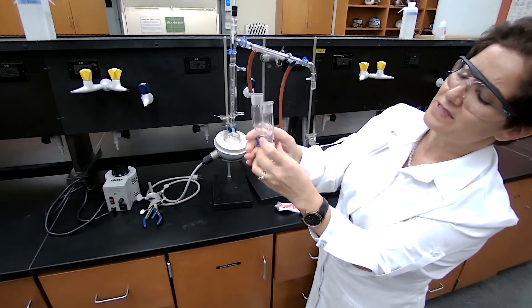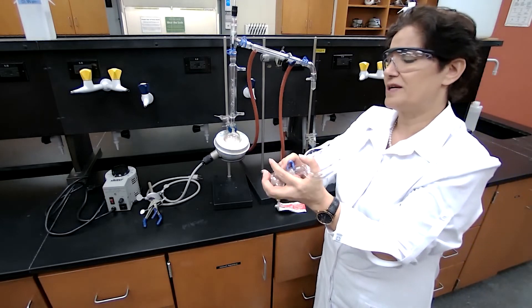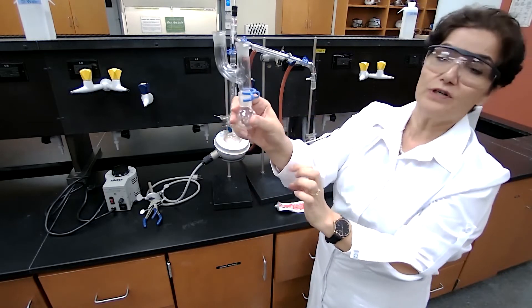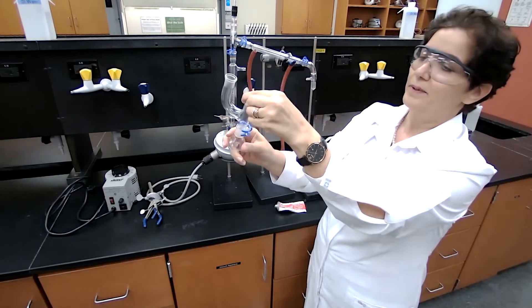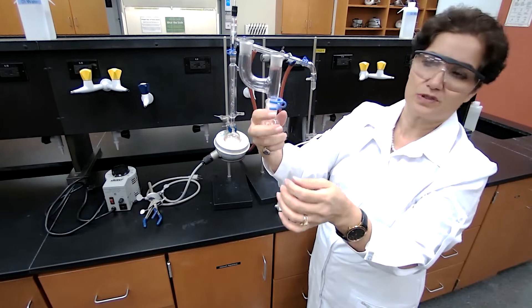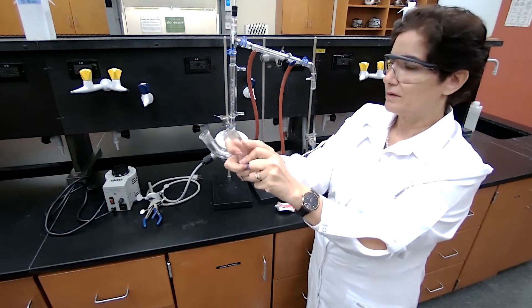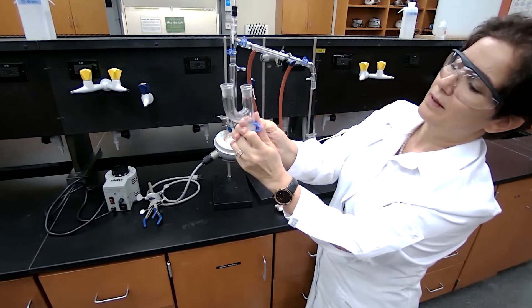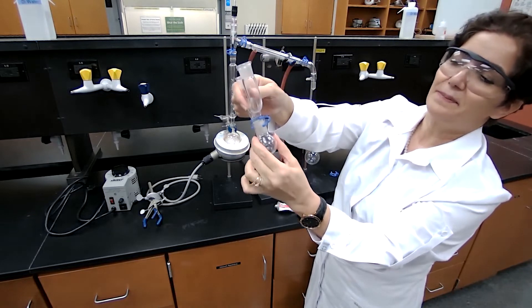If I force it without breaking, which I'm going to try my best to do the wrong thing - okay, if I forced it and it's there, someone looking from far could say okay it's holding, but it's not holding because it's not placed in the right position. I'm going to take it out and put it in the right way for you to see how it can protect the joints from separating.